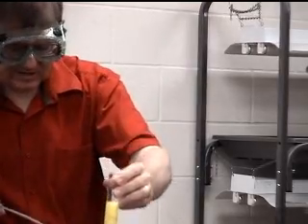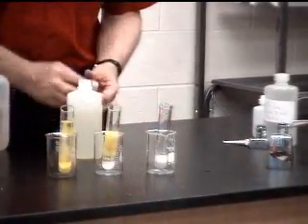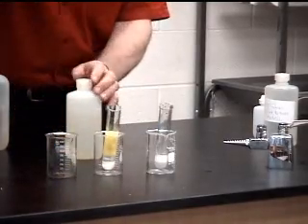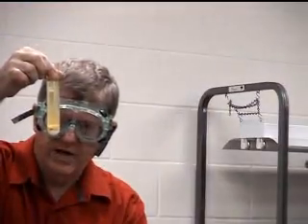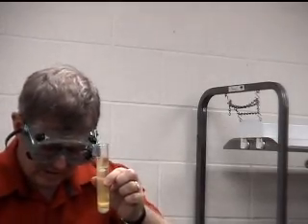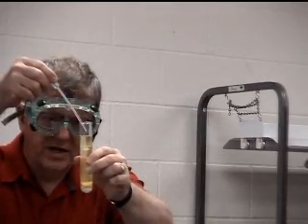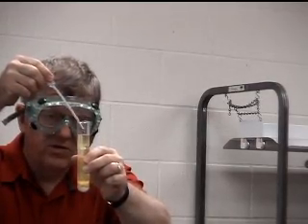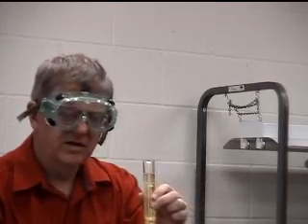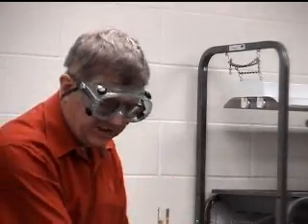Okay. That will mix in and settle. We'll give that time to settle, which we did in this case. Okay, and you can see that we've got the white lead chloride at the bottom, the yellow lead iodide, and so let's add some more potassium iodide. See, we get no more yellow precipitate. So what does that indicate? Well, that indicates that as far as iodide is concerned, all the lead is out. But is all the lead out?